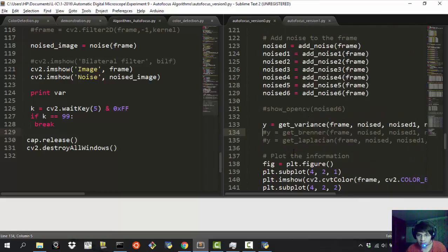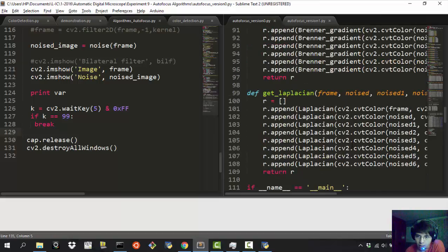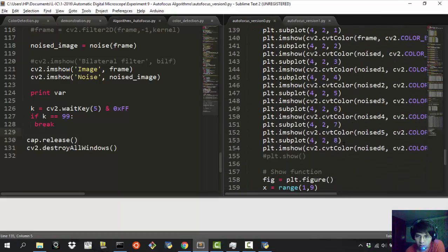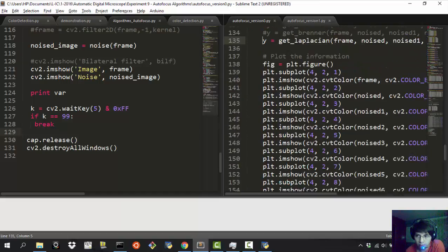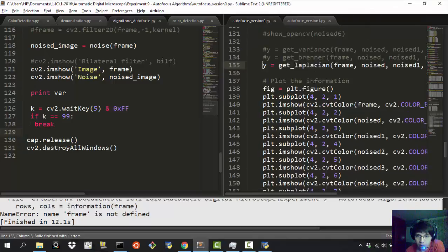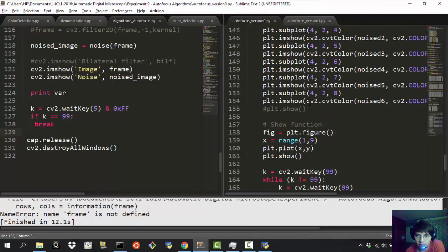And so let's see this. Let's move to the get Laplacian, and it's going to compute the same thing that I have shown you before. We're going to see the whole images, and then we're going to see the curve of the noised images. Okay, so there is an error here.